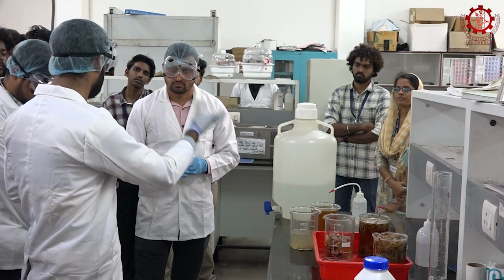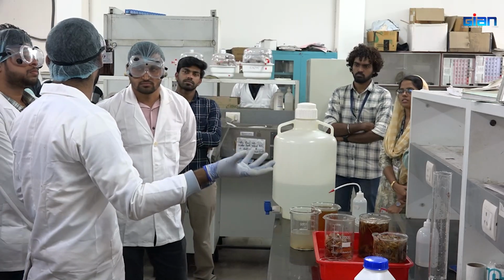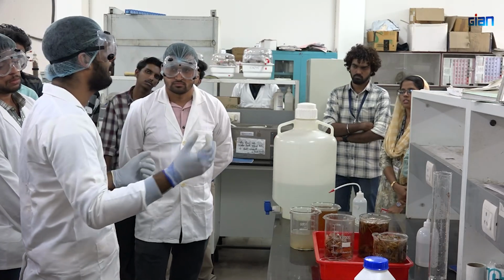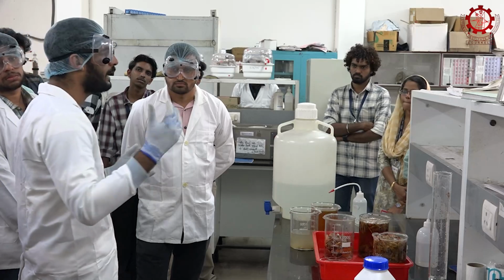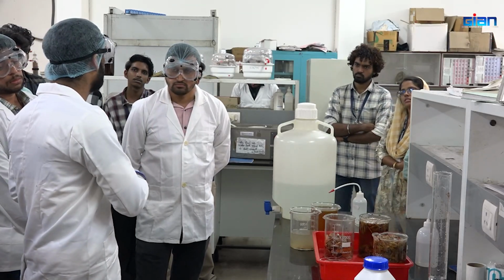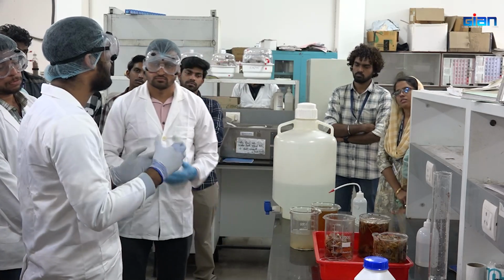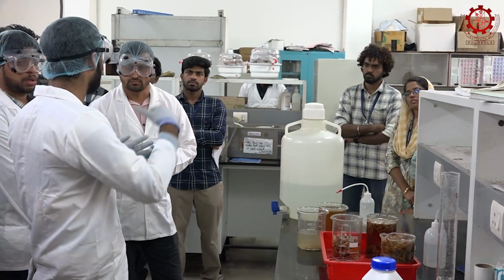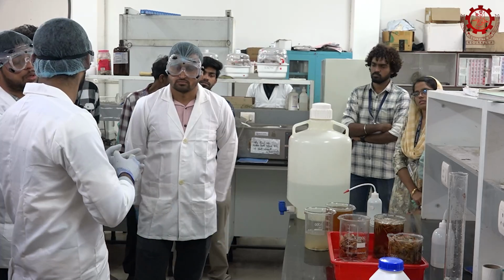and possibly if it is dried before afternoon, we can take the same chitosan for the FTIR analysis, or we will be taking some other already extracted chitosan sample for the FTIR analysis. We can check what kind of graph we are getting, and if the graph has any variation from the pure chitosan, then how we can differentiate it in FTIR. Any idea?